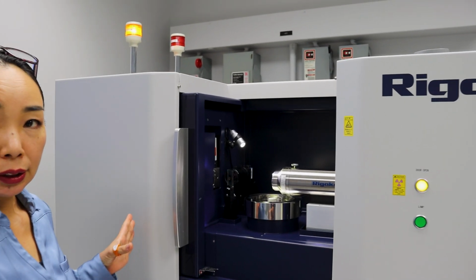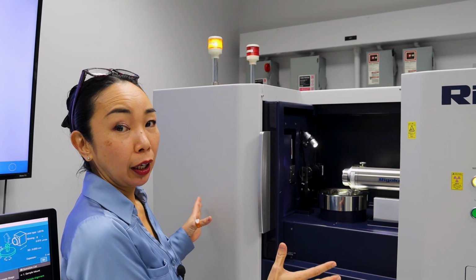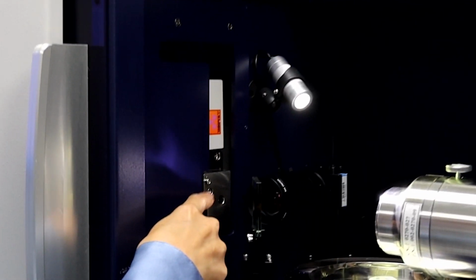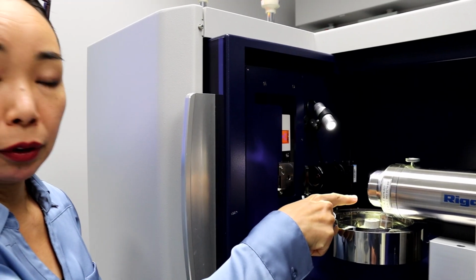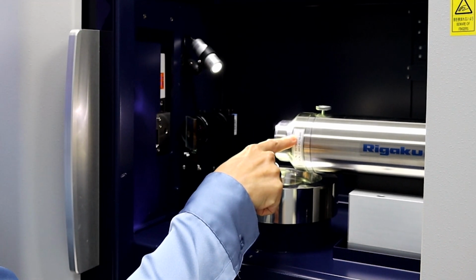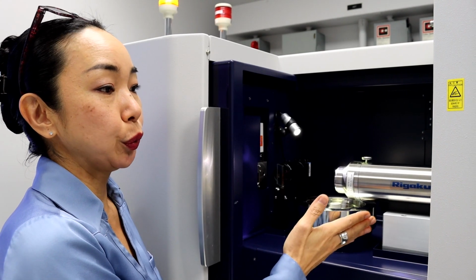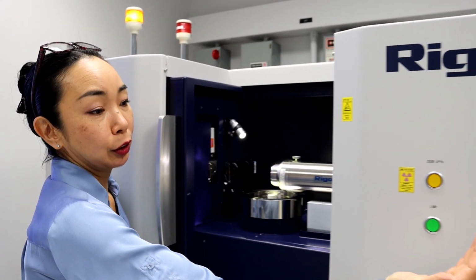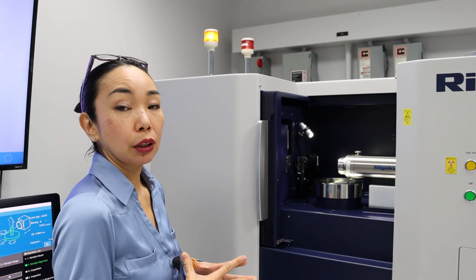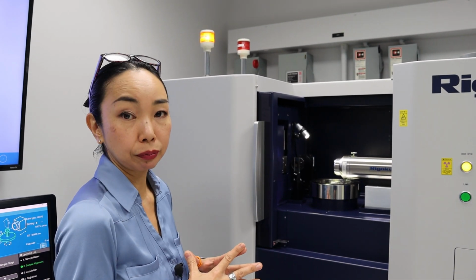This is the nano3DX, and this machine can achieve submicron resolution. You can't see it because it's behind the walls, but this is where the X-ray generator is. X-rays come out from this tiny hole here, and go to the sample. This is the sample stage. Then the X-ray image goes to this combination of scintillator and a lens, and that lens magnifies the image, and that goes to an sCMOS detector. Again, that is behind this one. You can't see it, but there is a detector here. The geometry we're using here is called the parallel beam geometry, which is very good to achieve a high resolution.